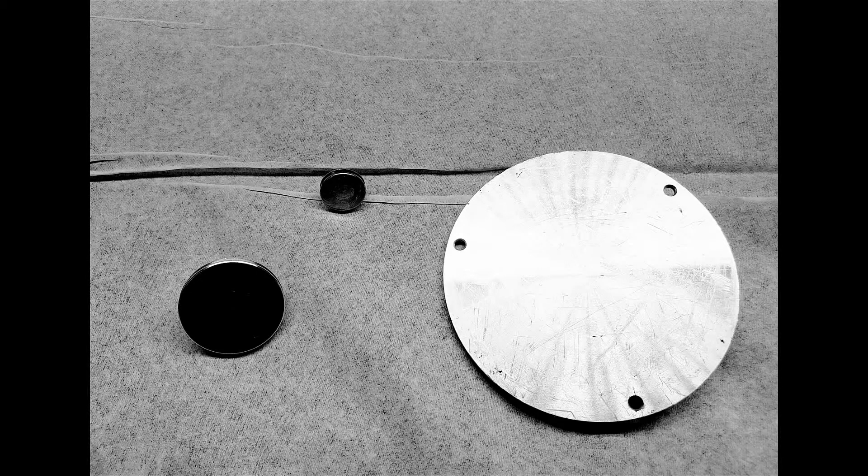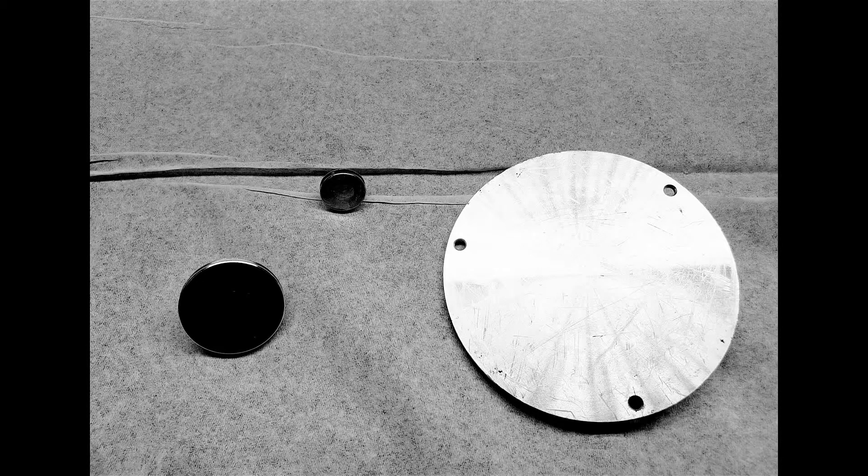There are several different types of holders available for your samples, both small and large size stubs, as well as a full size wafer holder which is able to accommodate 4-inch wafers.